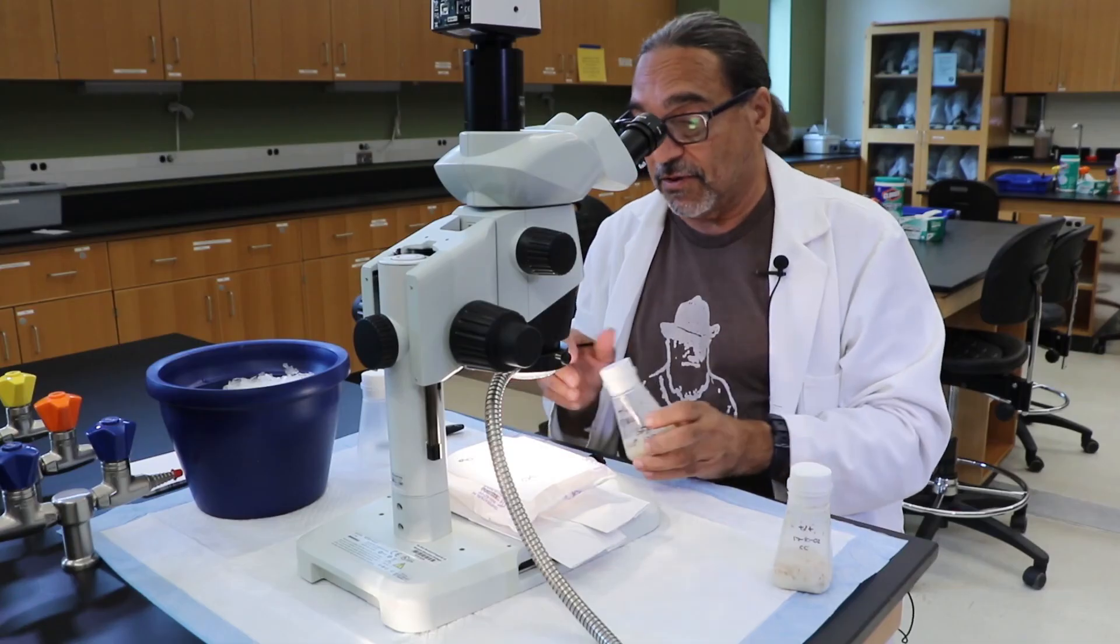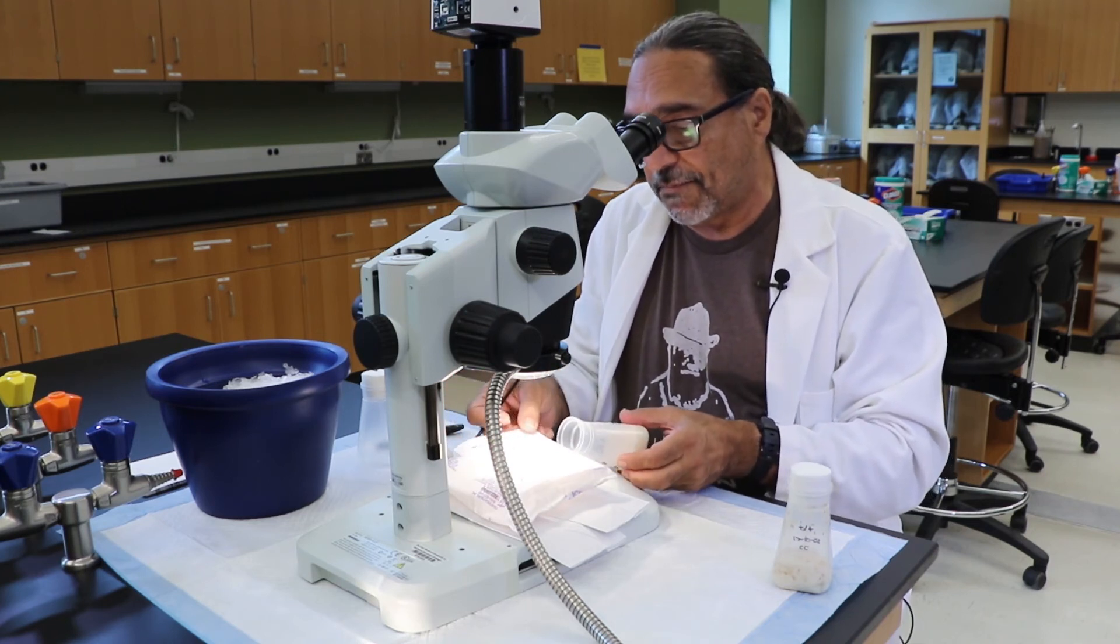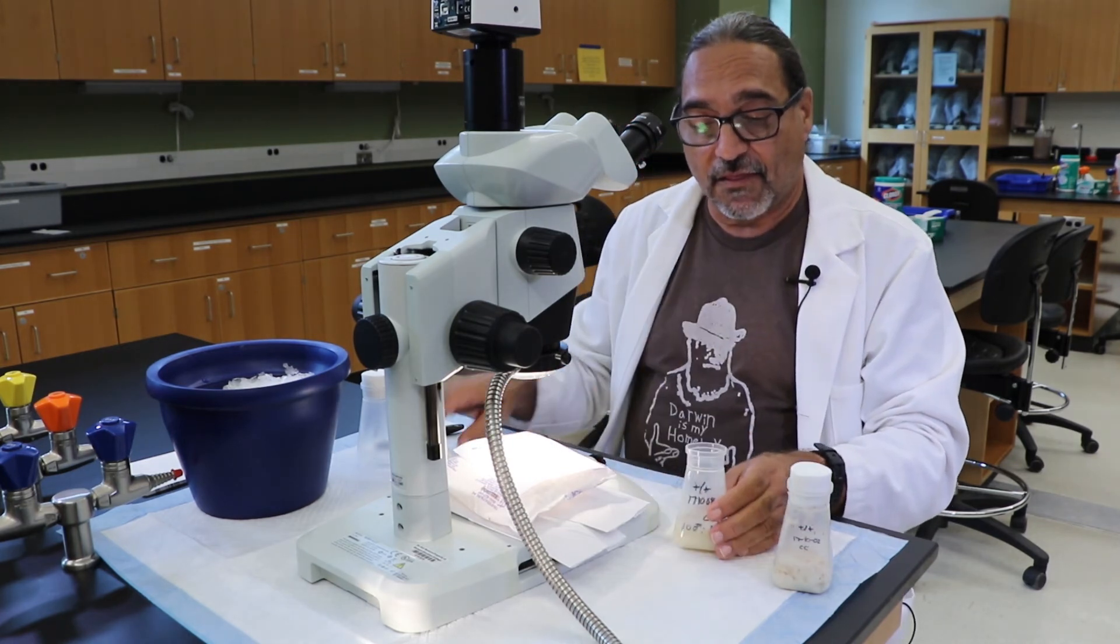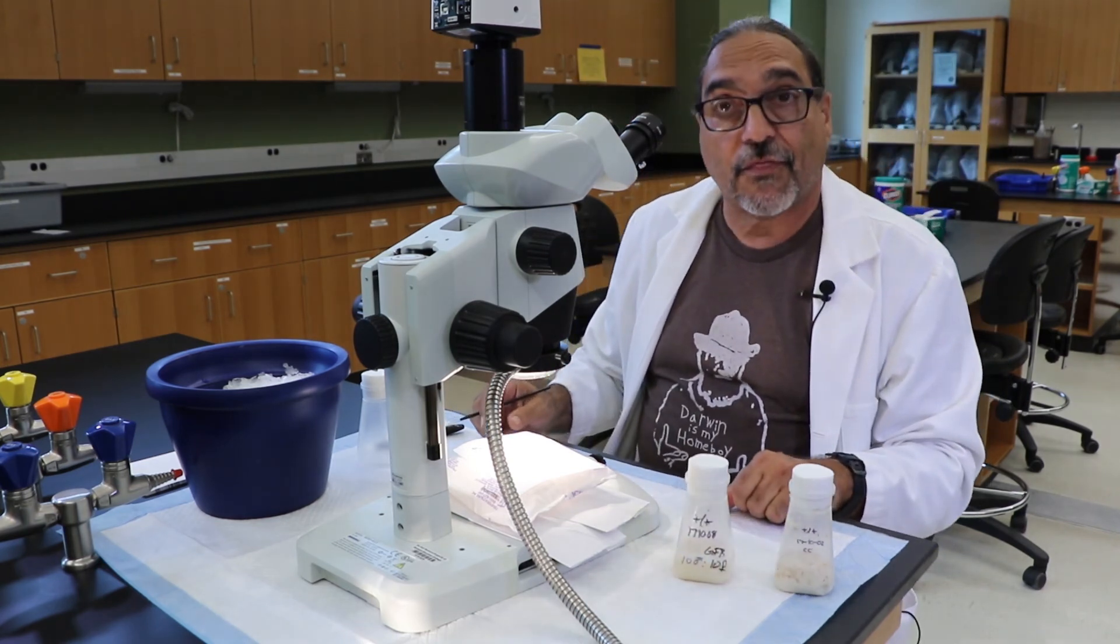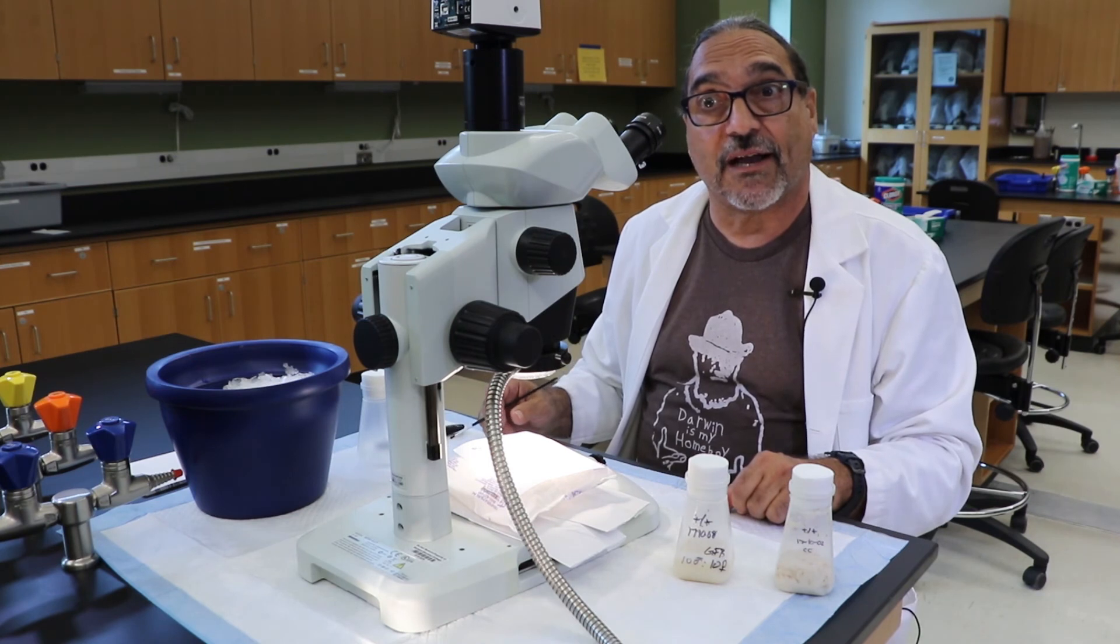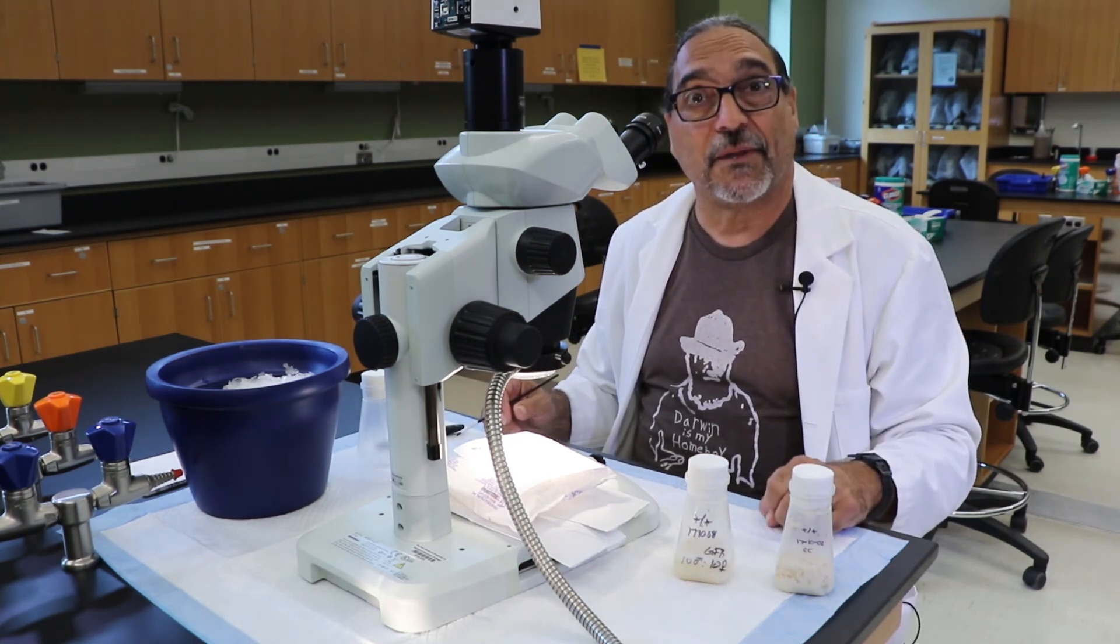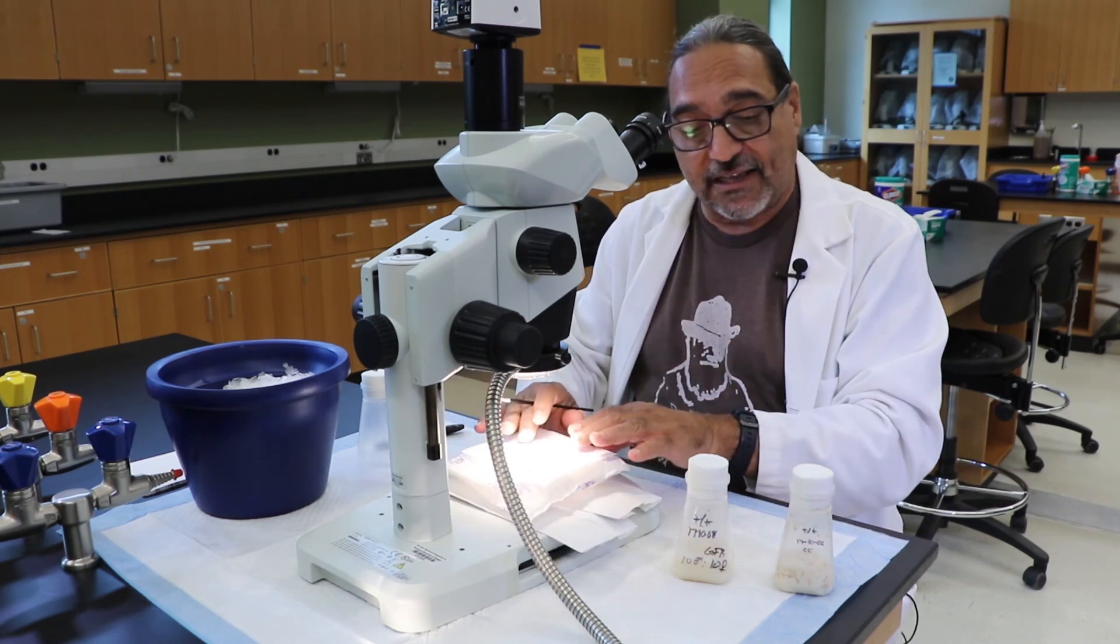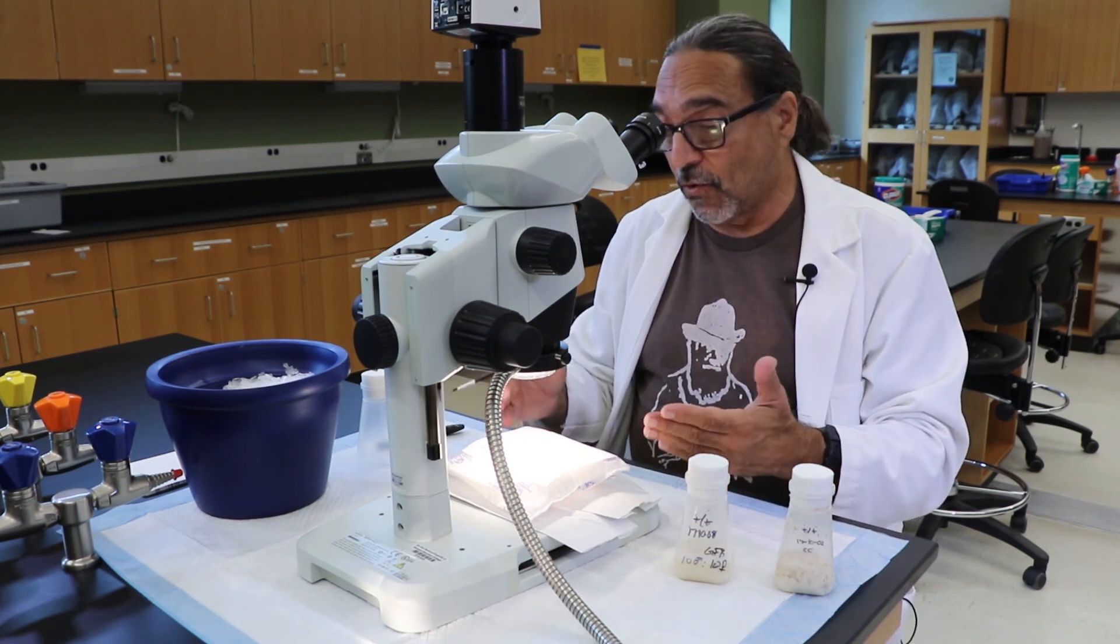We take our newly labeled stock vial, and all we have to do is sweep the counted flies into the stock vial. They are completely asleep, and in approximately three to five minutes, they will wake up and begin to crawl around the vial, and they'll begin the life of a fruit fly. The remaining flies can be placed in another stock vial or disposed of.